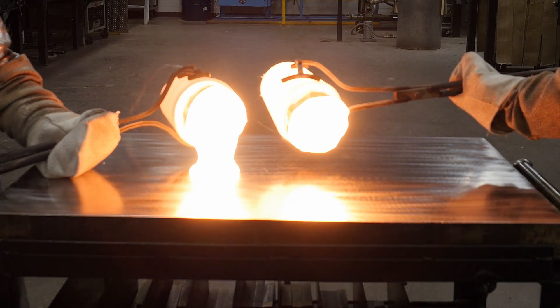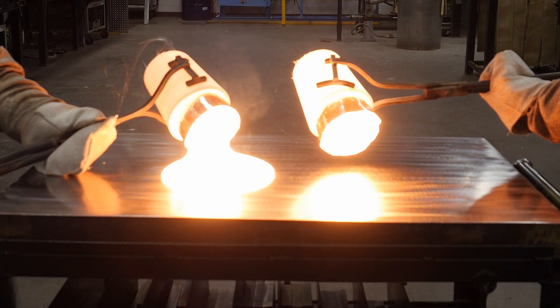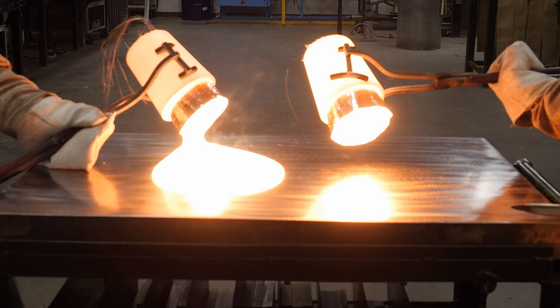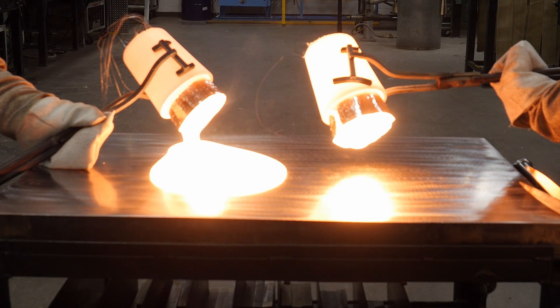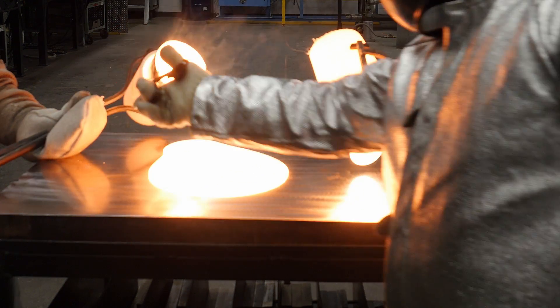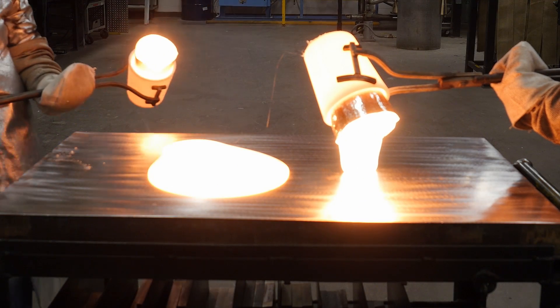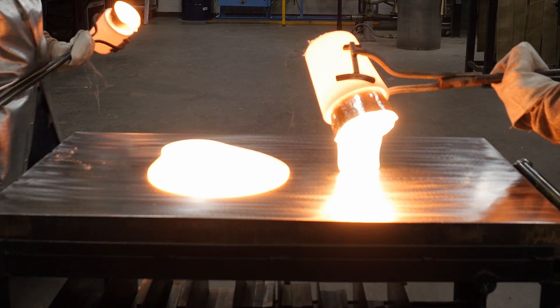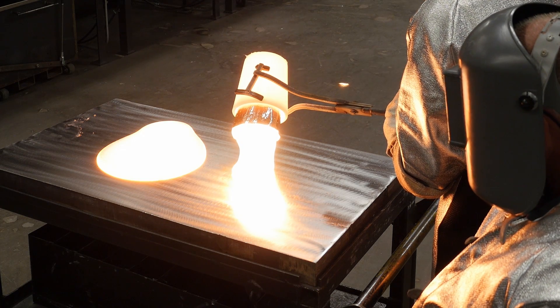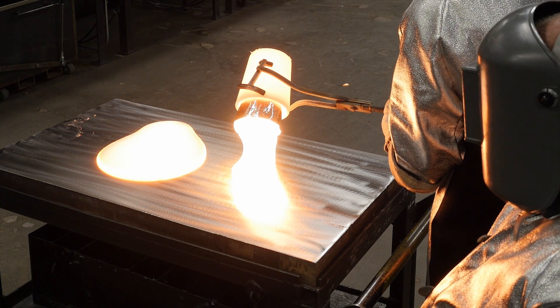In today's demonstration, we're going to look at how temperature and composition impact the viscosity of a glass. We've melted two glasses at the same temperature, but they have different viscosities because of the different chemical compositions. The glass on the left is a typical window glass called soda lime glass, which we consider a low viscosity glass. You can see it pours out of the crucible very easily, while the glass on the right, which is a higher viscosity glass designed for special applications, is coming out of the crucible at a much slower rate.